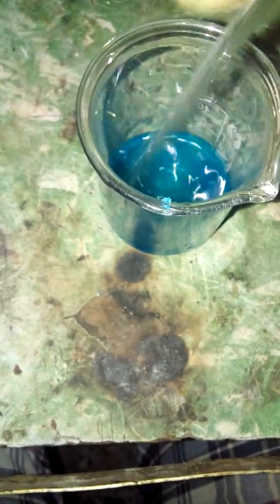It should be a really blue color. If it's greenish, you might have some impurities in your copper sulfate. I really suggest using hot water because copper sulfate dissolves faster in hot water. We're gonna add more water because I'm seeing some undissolved particles.